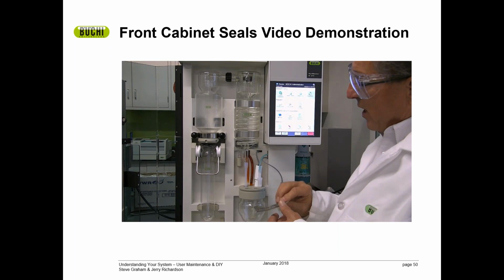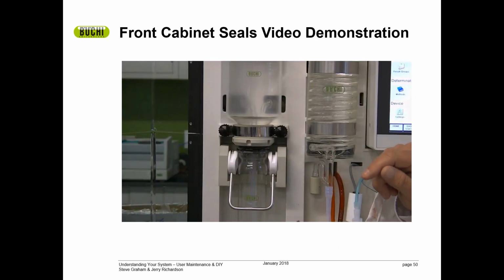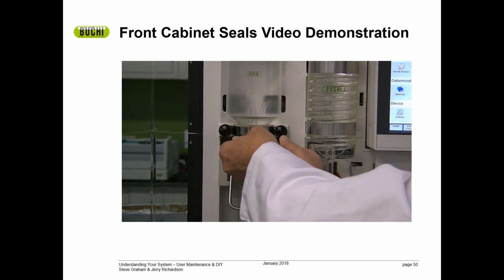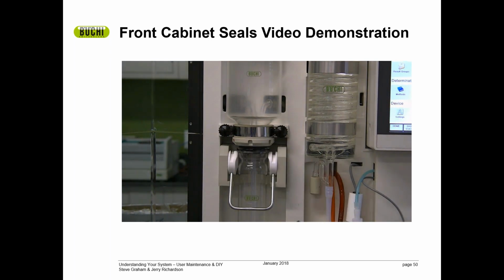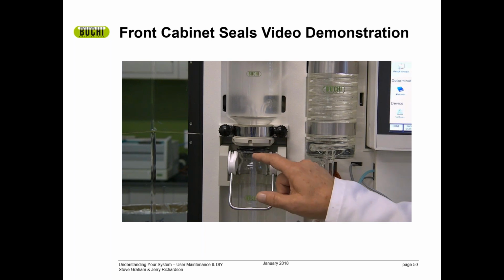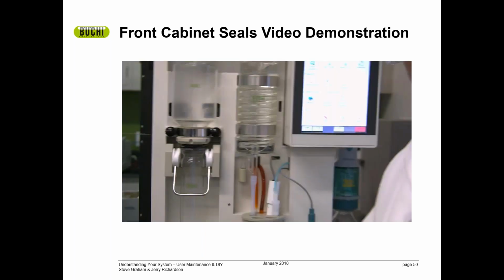There is another aspect of the sample bung to the bottom of the condenser tube. You use this tool to tighten that fitting at that point. It's very rare that that's a problem. This is very common to have a problem. And those are the seals on the front of the K375.